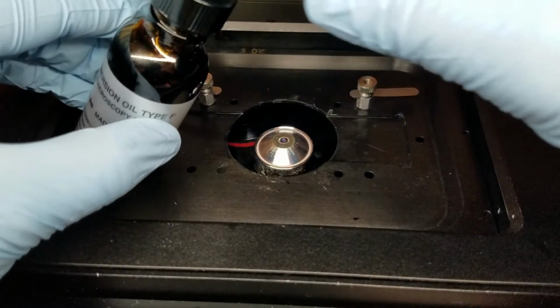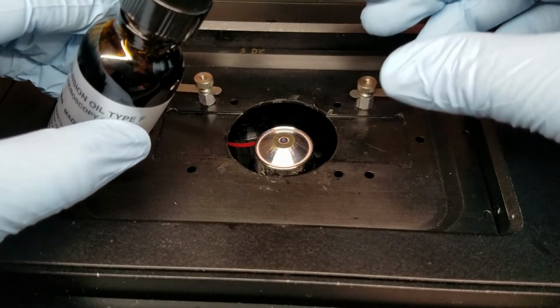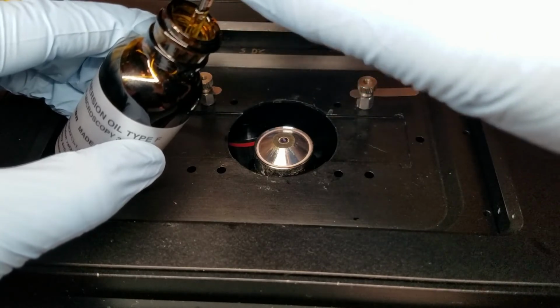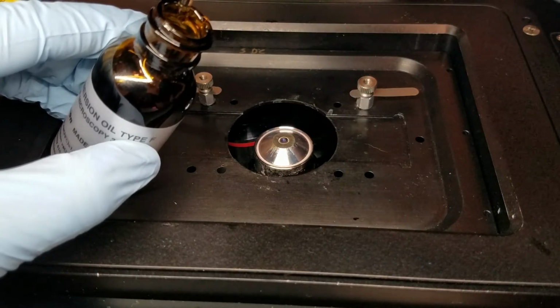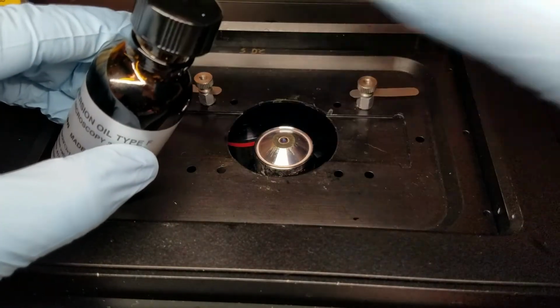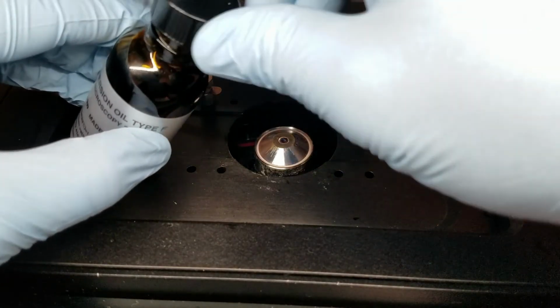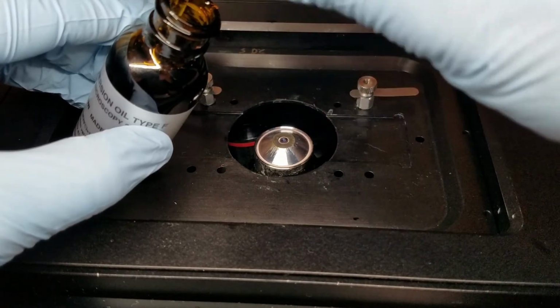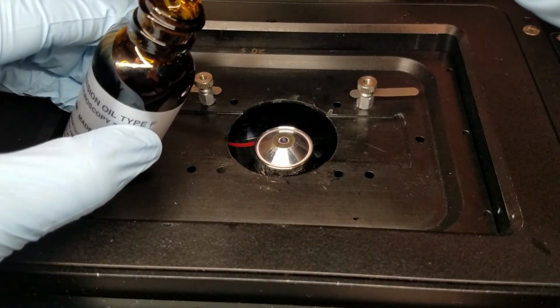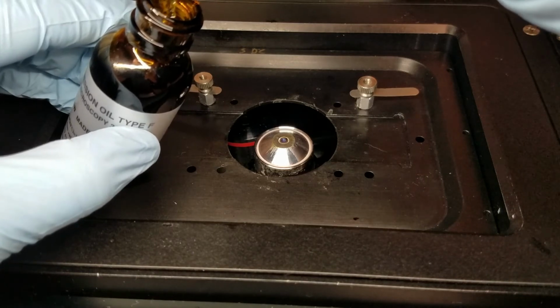Alright, so the lid is on and I'm over the objective, as you can see here. So what that really means is when we open this up, we have to be very careful because oil is going to come dripping off potentially fast, and we want to wait. Okay, or we want to make sure we don't have any excess drops. So I open it over the objective, I pull it out, and then I let it wait for a second. There's usually a couple drops that fall off, 2 or 3, right?